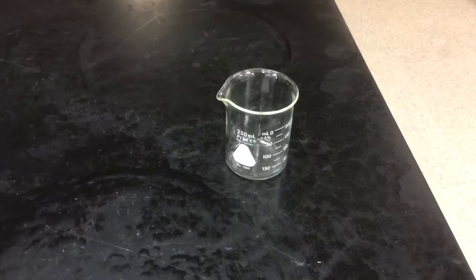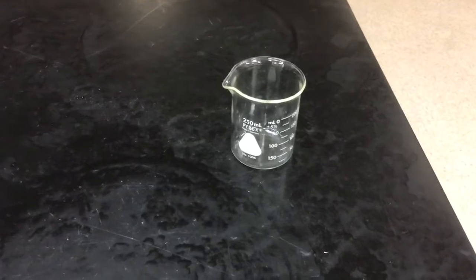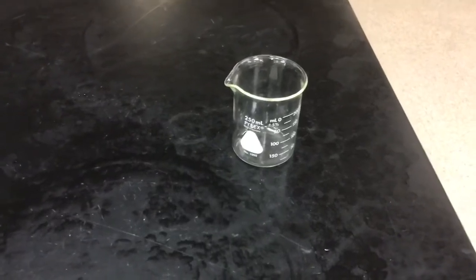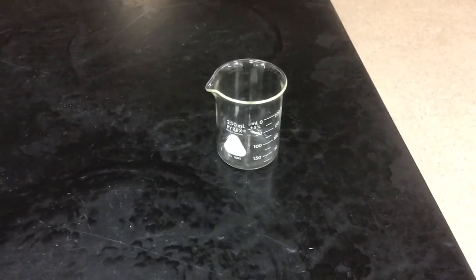Basically we remove all the liquid, and after the water evaporated, whatever mass the beaker gained is attributed to dissolved solids. If it doesn't take on any mass, then we know that there's not enough in there to be worried about.